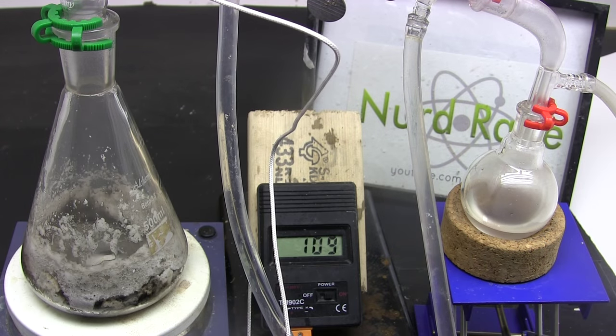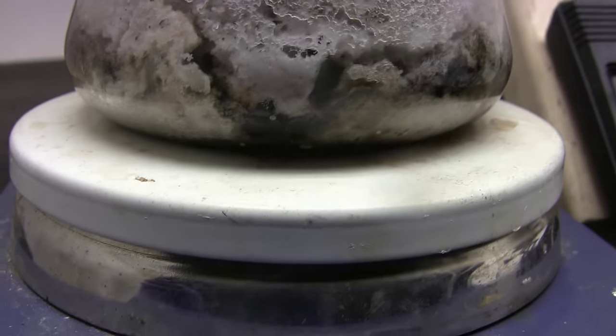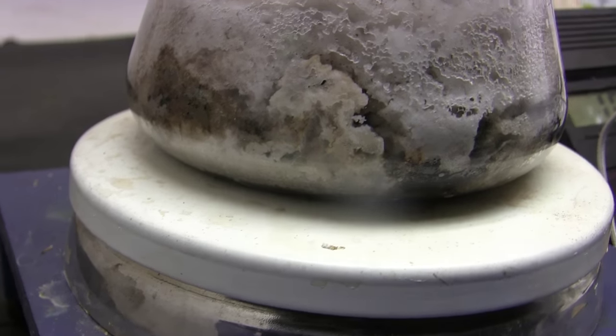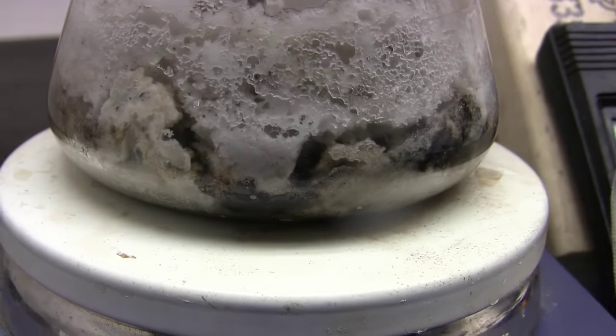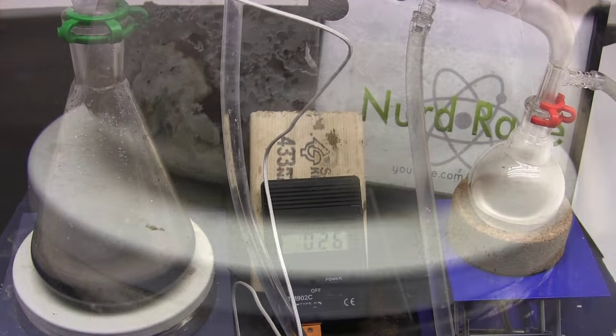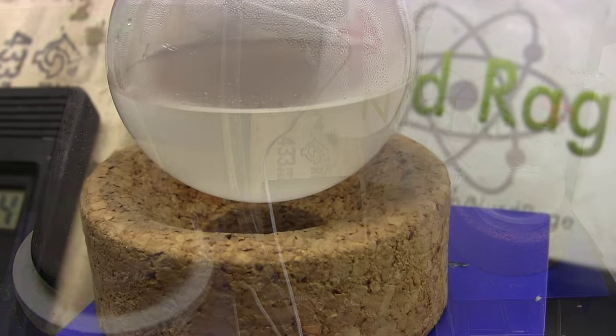Oh, looks like I blundered here and didn't adequately mix the sodium propionate and sulfuric acid beforehand. So there are a few chunks of unreacted sodium propionate and the mixture is too thick to mix in the remaining sulfuric acid. To solve this I just added a lot more sulfuric acid to ensure everything is dissolved. If you're stingy about using sulfuric acid then be sure to crush up and thoroughly mix the sulfuric acid and sodium propionate beforehand. Anyway, once distillation is finished we now have a crude sample of propionic acid.